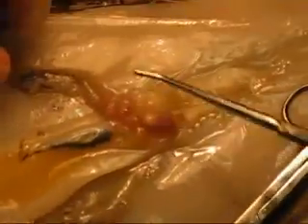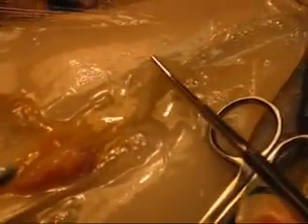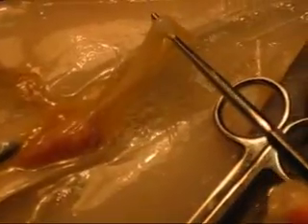Now here's the stomach of the squid — red. From Pretesh's example, it was big because the squid ate a lot. Underneath the stomach was a big yellow thing called the cecum. And underneath the cecum are the testes.